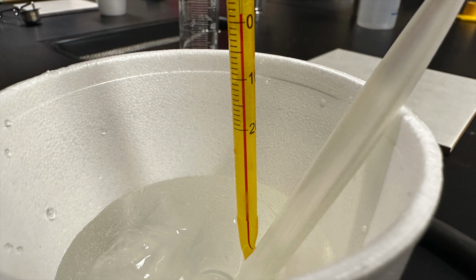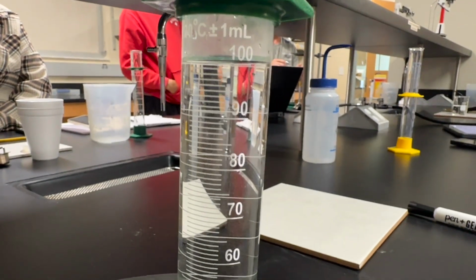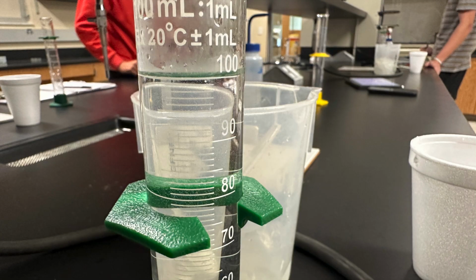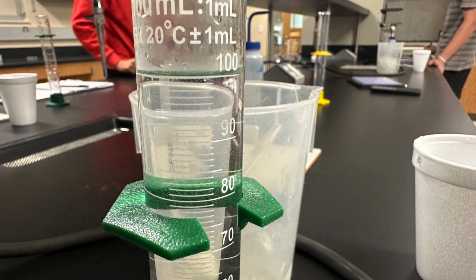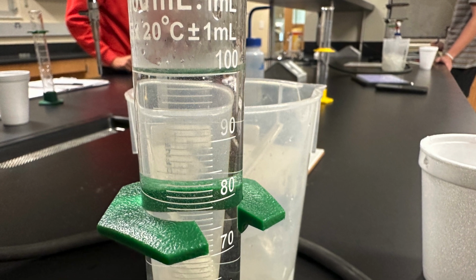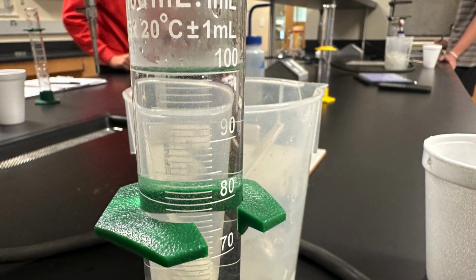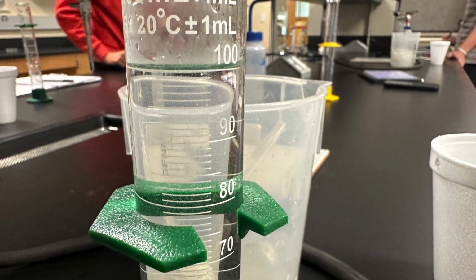We're going to do it a third time. So here's our initial temperature. We're going to add our ice and stir until we get to just about 0 degrees, or as close as we can get it. We emptied out our water. We had our first 100 milliliters, plus our additional amount that you see here. So we repeated this step 3 times.